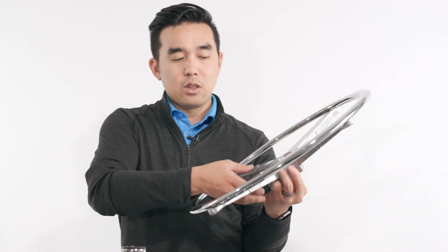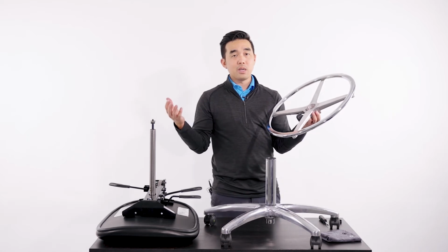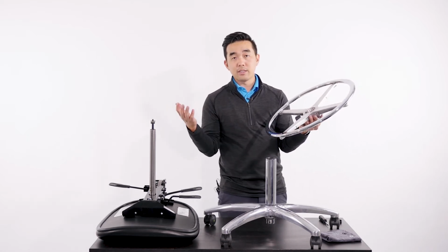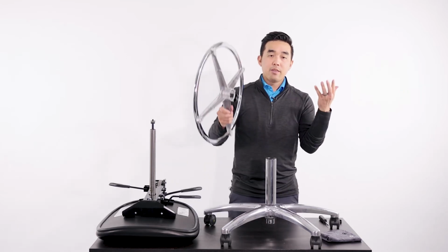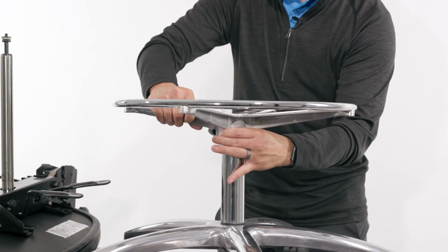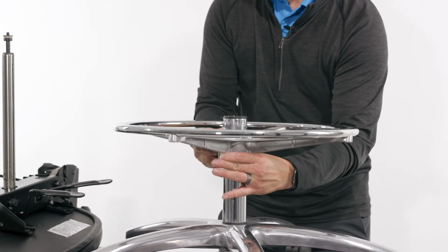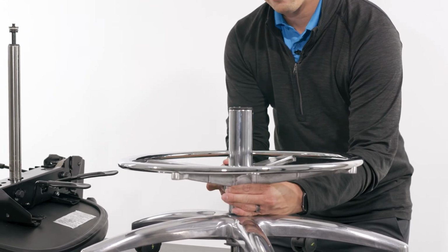That's what keeps this thing locked into place when you tighten the knob. And so if you need another one of those, let's just say something got lost or damaged, contact us and we can get you a replacement for that as well. We would then take our new foot ring, slide it in right on the top, drop it down into place, tighten it back up.